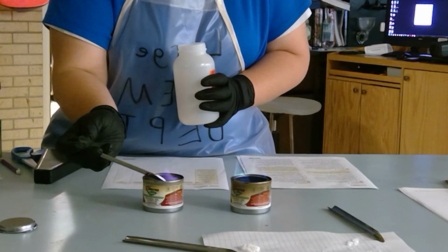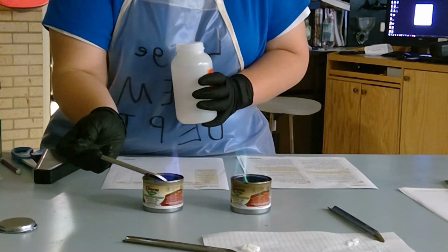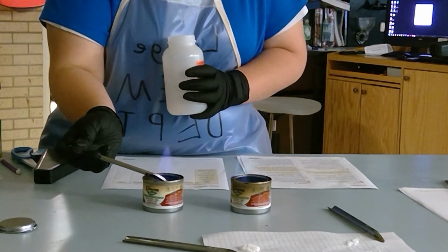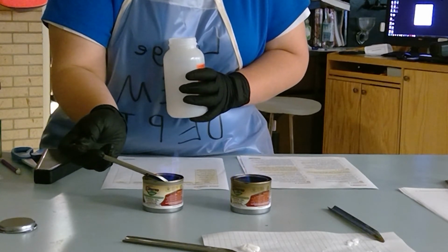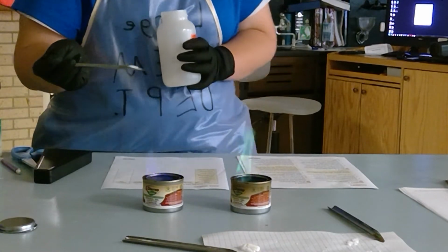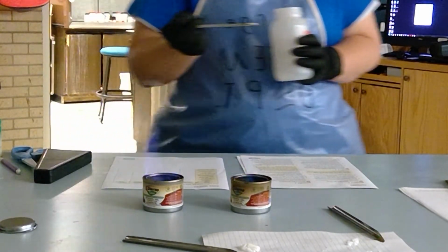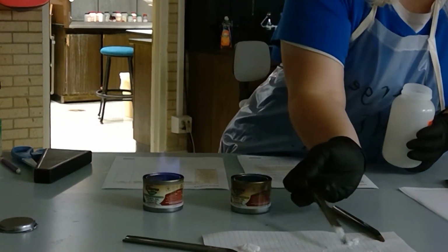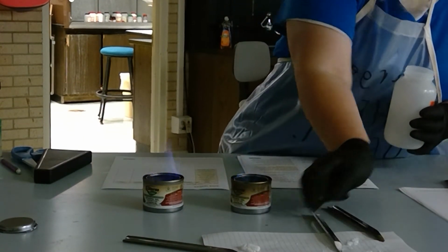I accidentally spilled some in there, but now you can really see that color. Which one of those substances, potassium chloride, lithium chloride, copper chloride, or sodium chloride, will give you that purple color of a flame? I'm not sure going with that green one again is going to be my best choice.